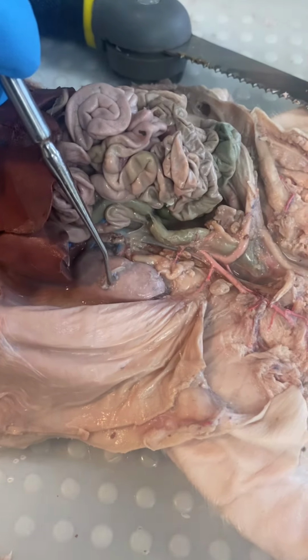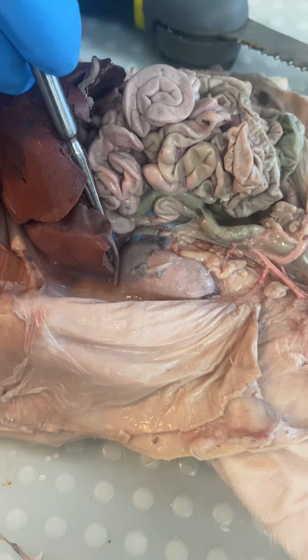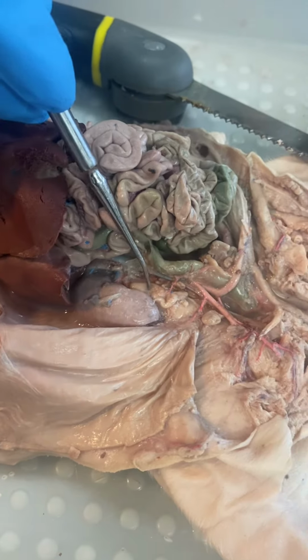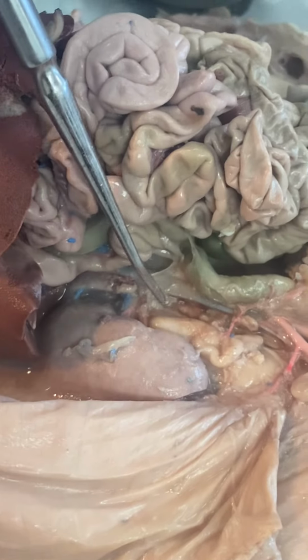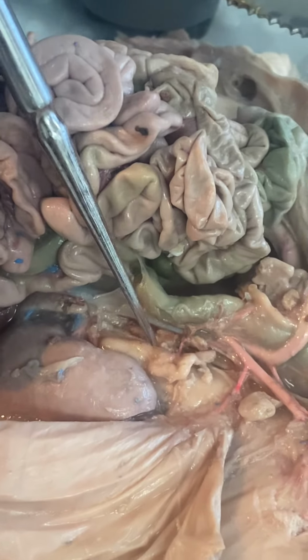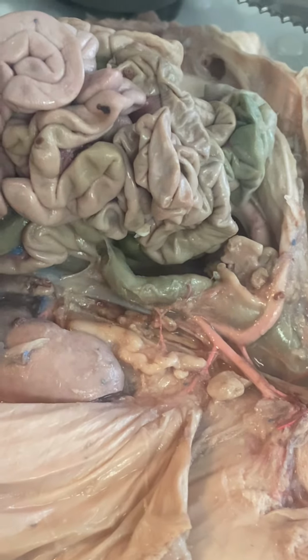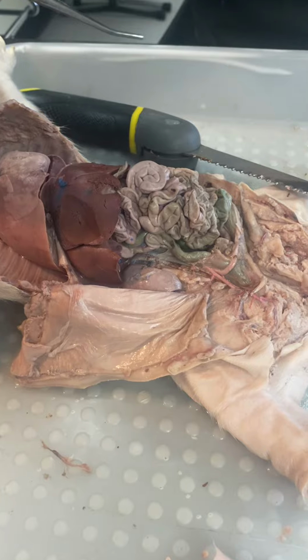This here's a kidney. It filters your blood, and it filters all of it really quick, actually. And this is your ureter. It takes whatever your kidney filters out, including urea and uric acid. If you have too much, say, glucose in your bloodstream, it's going to filter it out.